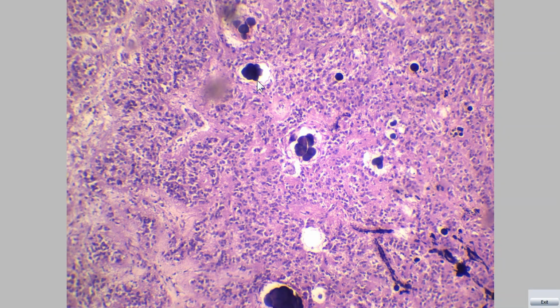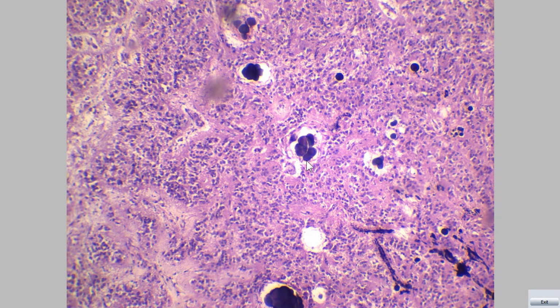The main characteristic feature of this slide or this organ is the presence of concretions of calcium and magnesium salts called brain sand. Basophilic structures. Concretions of calcium and magnesium salts called brain sand. And the cells are called pinealocytes.